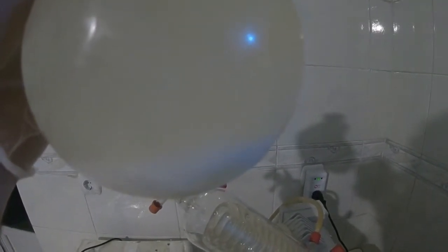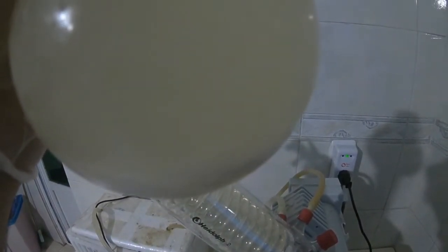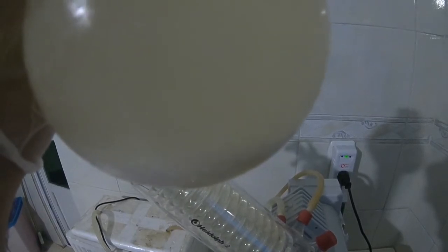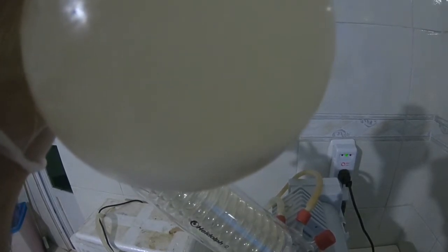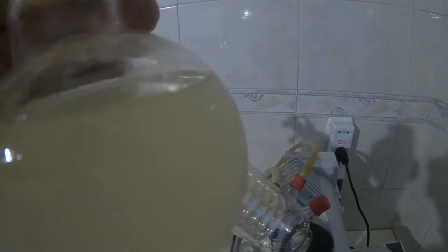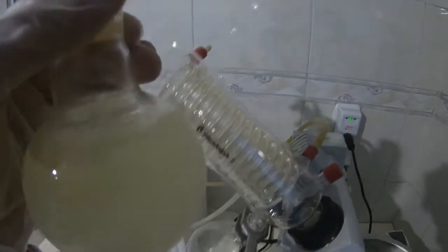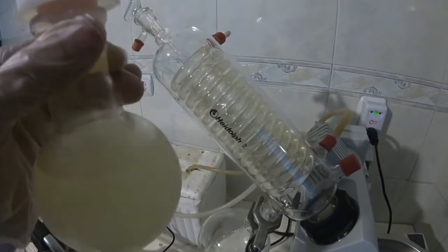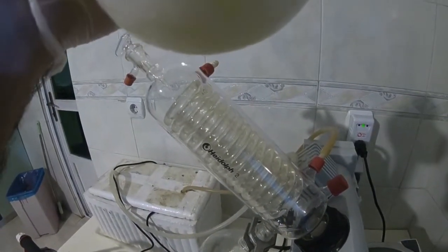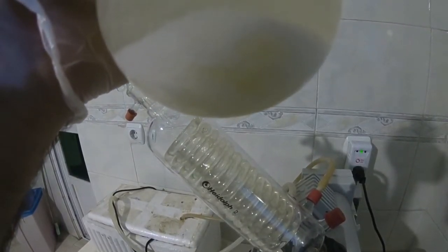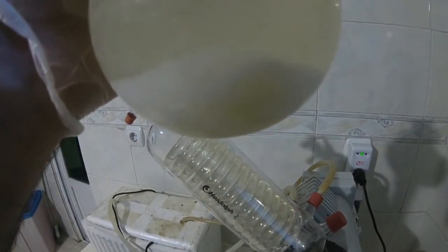So if you want to extract carbamazepine from its pills, it is just enough to crush them and let them stir with enough methanol at room temperature, and then concentrate the methanol to half or one third of the initial volume and let it crystallize. For the selection of the solution volume, you can use 5cc per 80 milligrams of the carbamazepine. I will filter it and show you the final product.